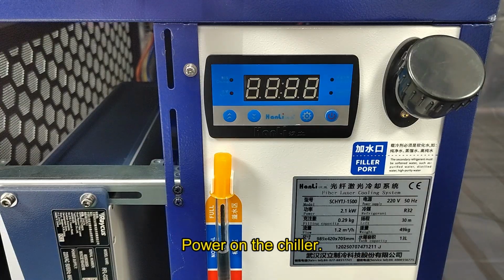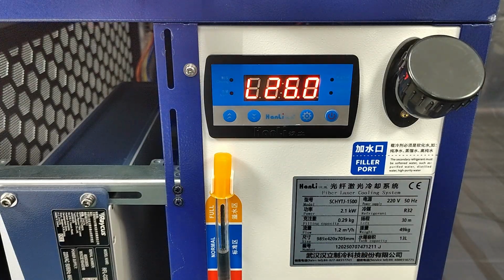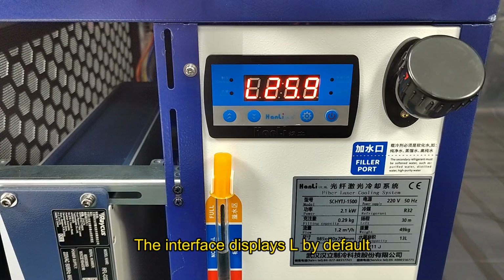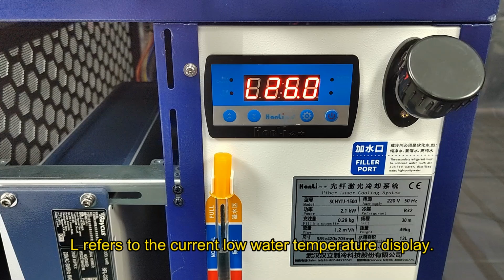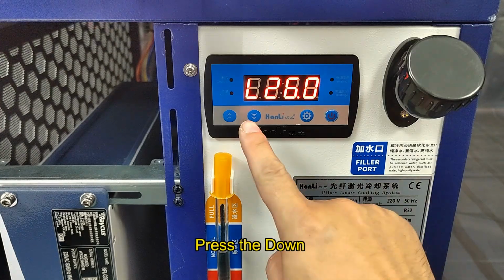Power on the chiller. The interface displays L by default. L refers to the current low water temperature display. Press the down arrow.